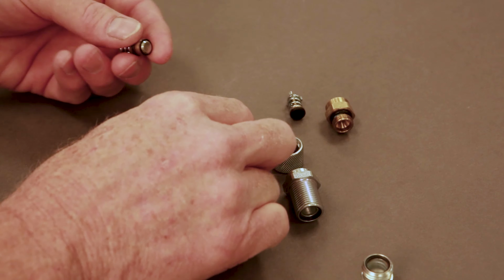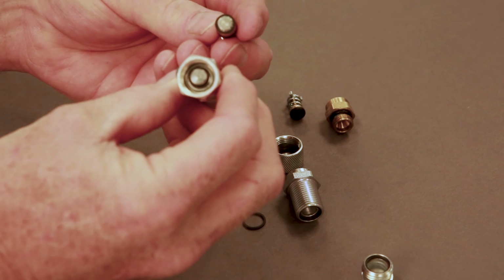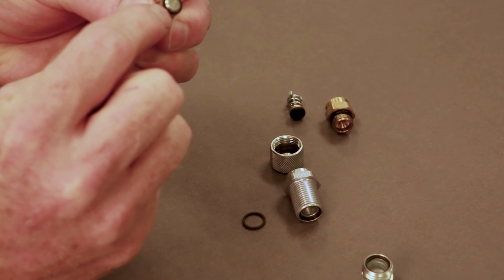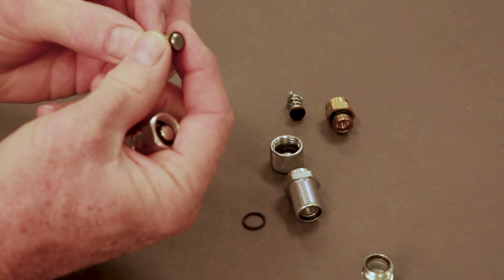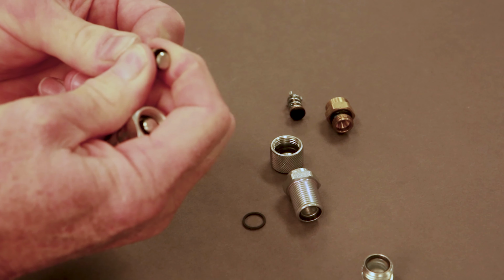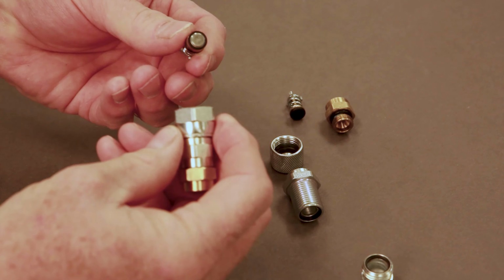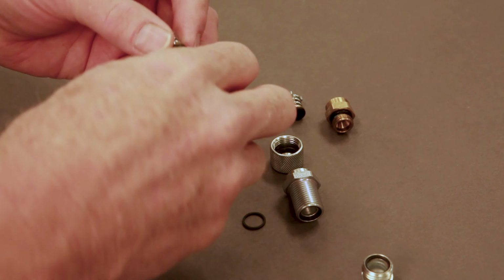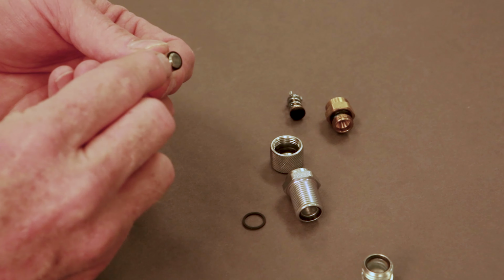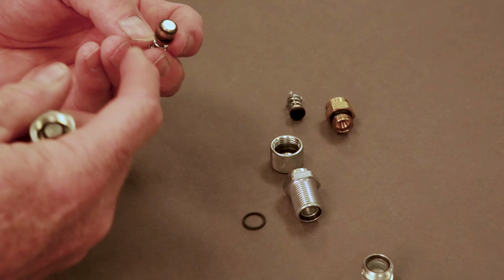On the other side is the valve assembly here. This seal will sometimes fail. This works by the center coming up when the connector is mated. When it's unmated, if that seal has failed, then it will leak. It'll be bulged out to the side and gas will go around it.